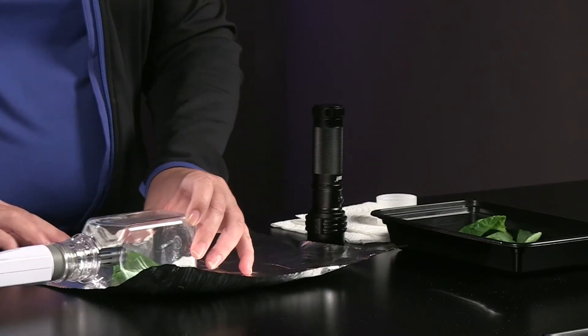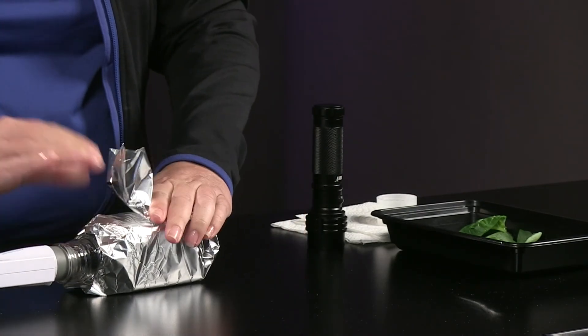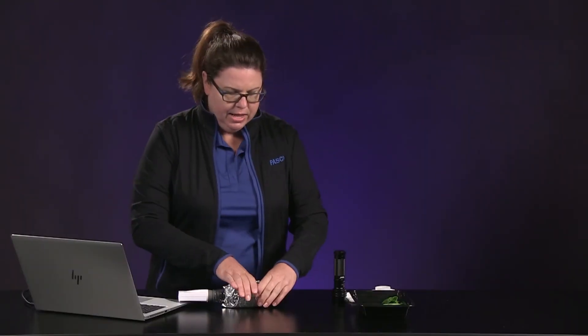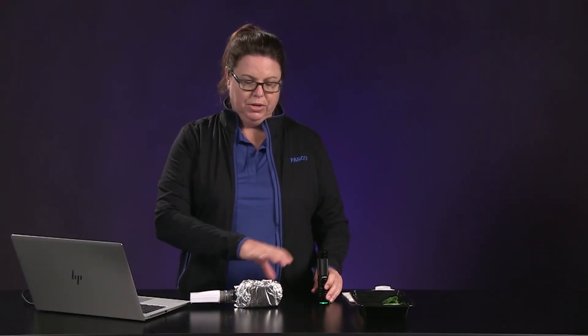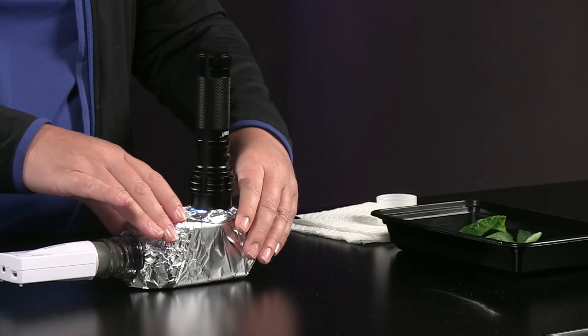Now we will move to part two and investigate how leaves behave in darkness. We want to keep the system closed, so wrap the bottle in aluminum foil to get a good seal. Since the only thing we're changing is putting the leaf in darkness, keep the light positioned on top to control for that variable. Let the system rest this way for about a minute, and while you do, make a prediction: what do you think will happen to the CO2 level in the bottle while the leaves are in the dark?